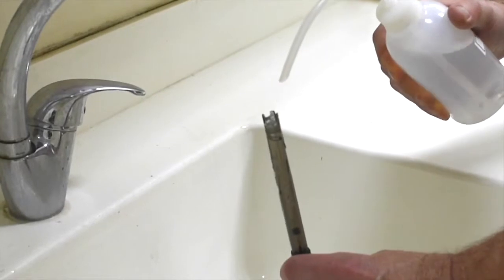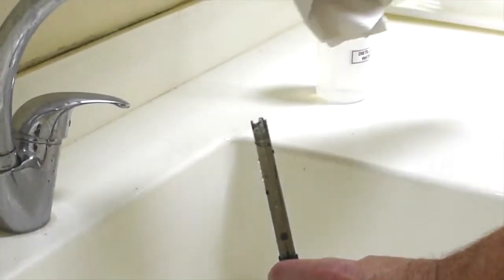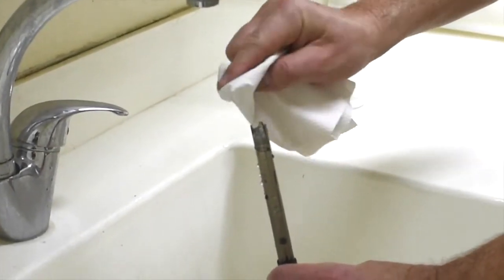Before any use of the sensor, rinse the electrode off with distilled water and then blot it dry. Remember, never wipe the electrode dry.